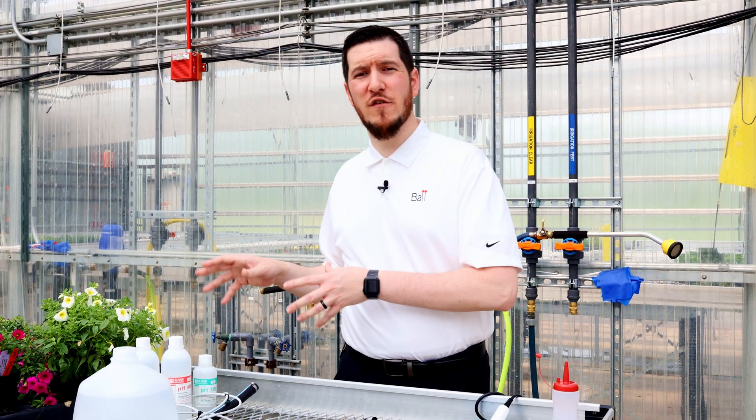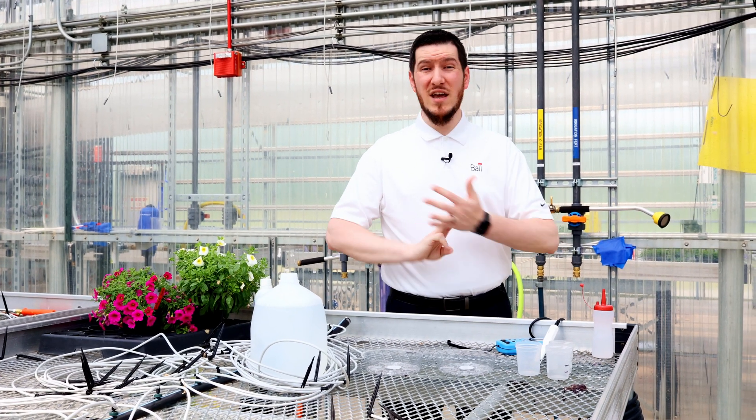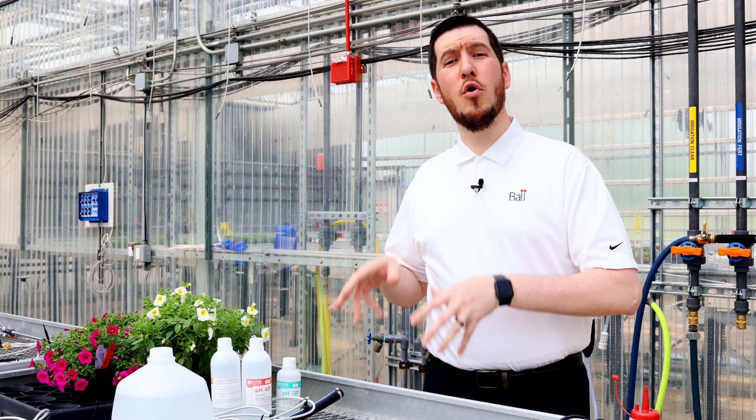Collecting soil samples from multiple pots, pooling them together, and sending them to a lab is easy and doesn't result in the destruction of plants, but it can take a long time to get results depending on the lab. That's where field testing methods like the pour-through method come in handy because they're fast and easy — they can be done on the fly as you're watering and walking through your crops. There are several other testing methods like saturated media extract or two-to-one, but we're going to show you the pour-through here today.